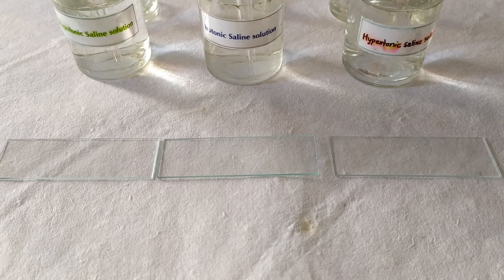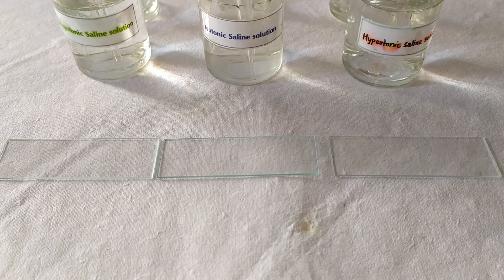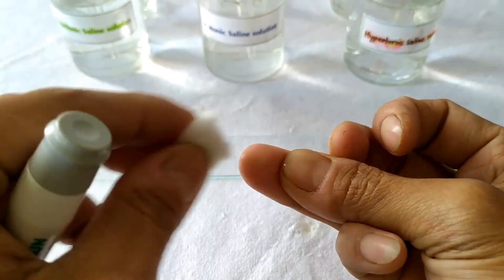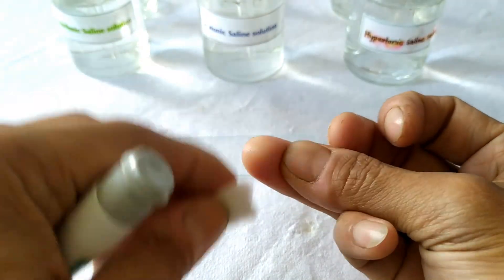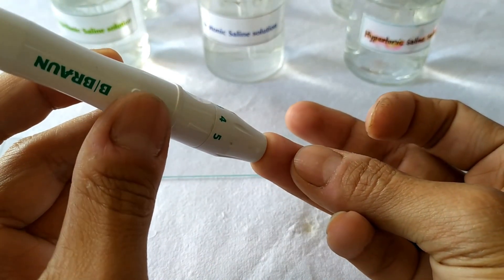Begin the experiment by taking three clean and dry glass slides along with the three different tonic solutions, with a dropper in each bottle. Clean a finger with alcohol and prick it using a lancet or pricking device.